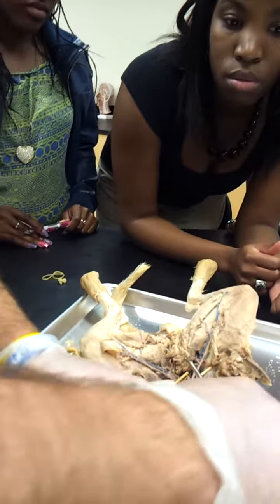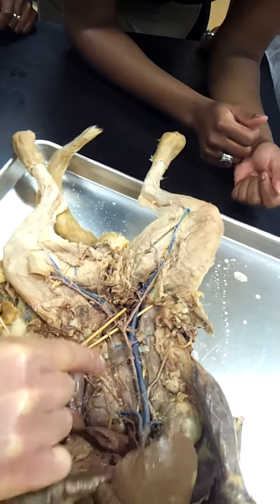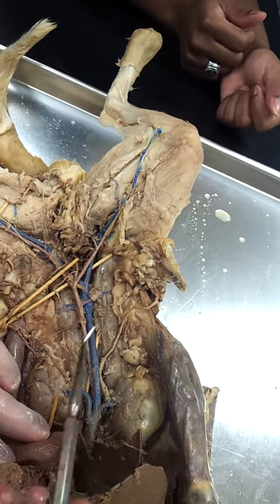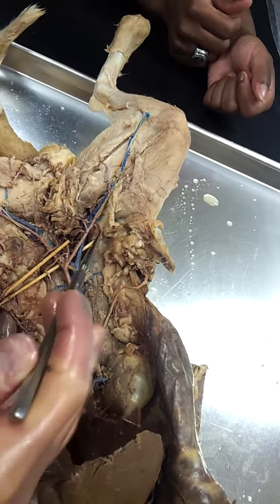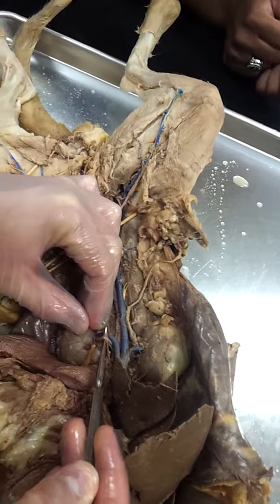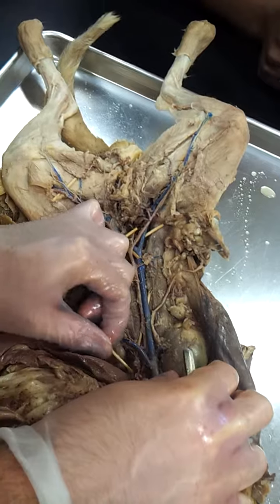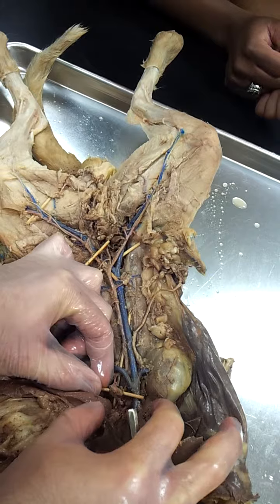No. So as we shift down to the abdomen, we've got that IVC that's going to continue all the way down throughout the abdominal pelvic cavity. And then we've got these two organs here, which are what? Kidneys, also called renals. So the vein going there, renal vein, and then the artery going to the kidney, renal artery. I tried to stick underneath it, but if you can see this little bulb, that's the gland. What gland is that? Adrenal gland.